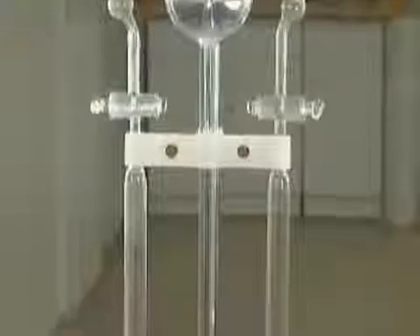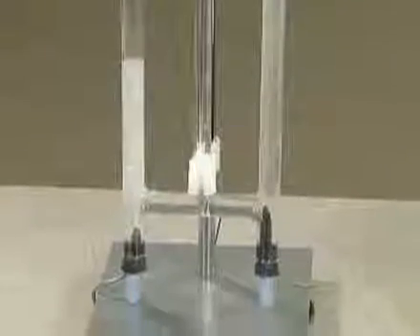After some time, we notice that the volume of the gas released at the cathode is double that of the gas formed at the anode.